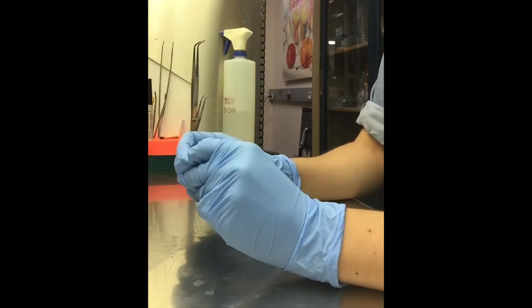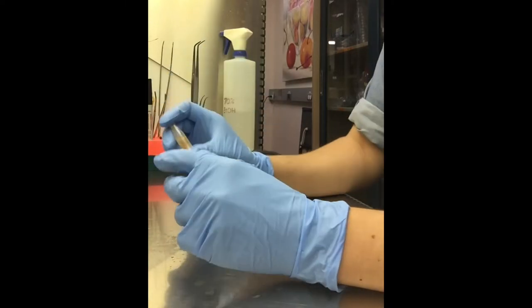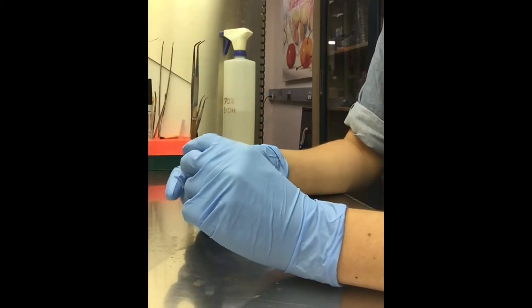So now this is probably the shortest wash. This is the third wash. By now they should be pretty clean, so we'll go for about a minute.